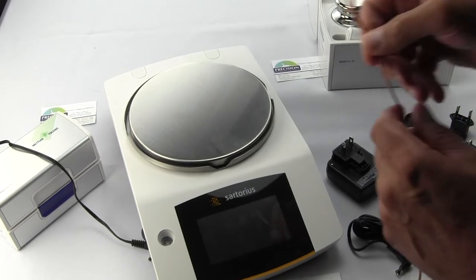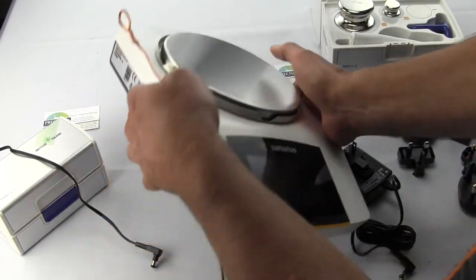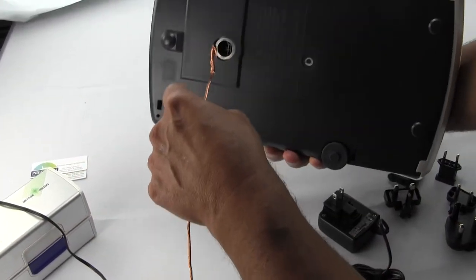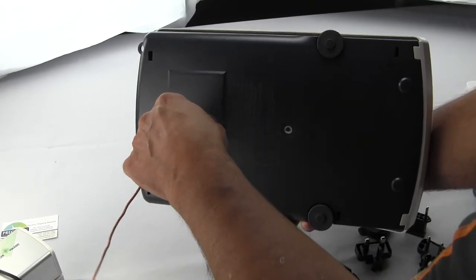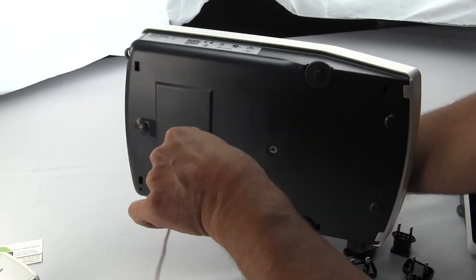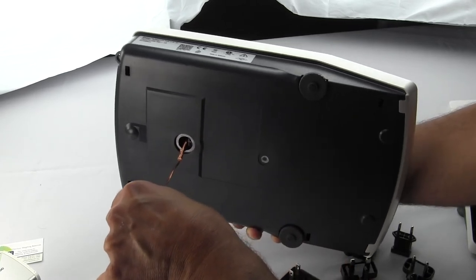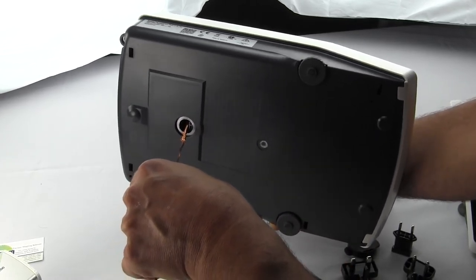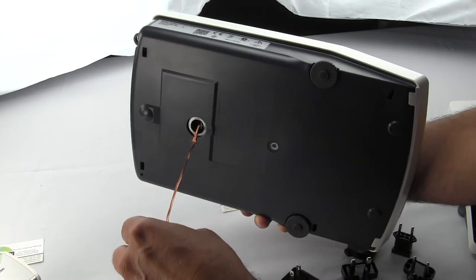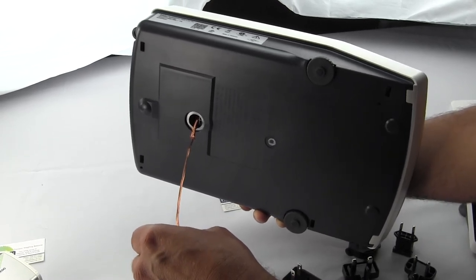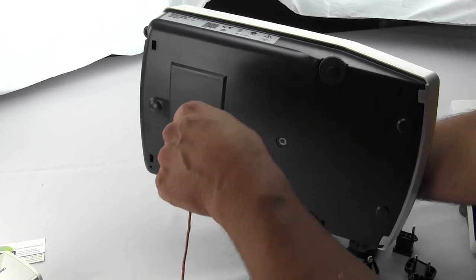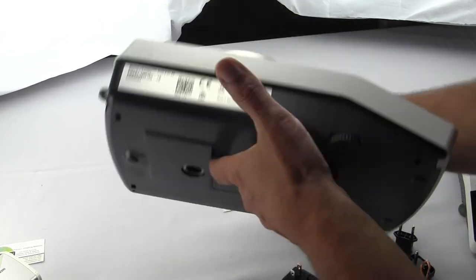I've set up copper wire, and you would just put that loop right on that hanger. From there you could hang whatever body you want underneath. Typically this is used if you're weighing something that is hot or magnetic material, because you would not want to put that on the balance.